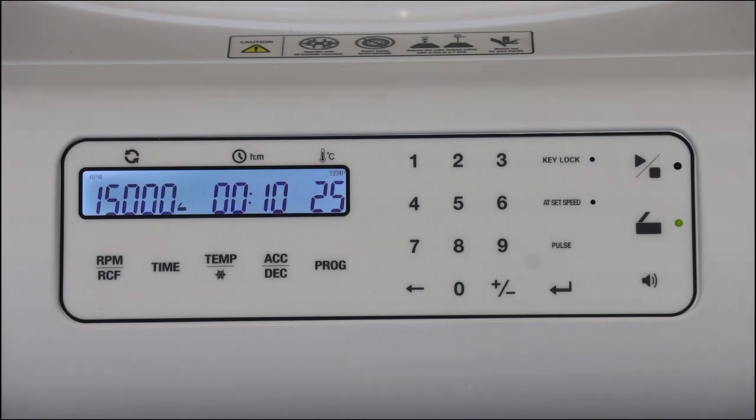For parameter settings, using the numeric keypad, you can set the RPM or the RCF, time, temperature, acceleration and deceleration rate, or you can call or save programs.